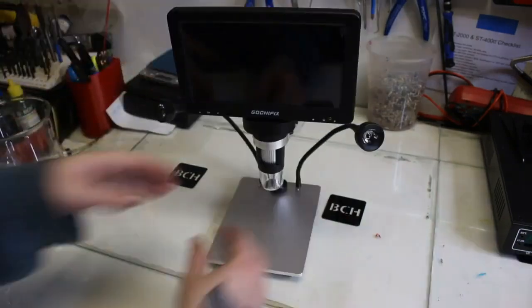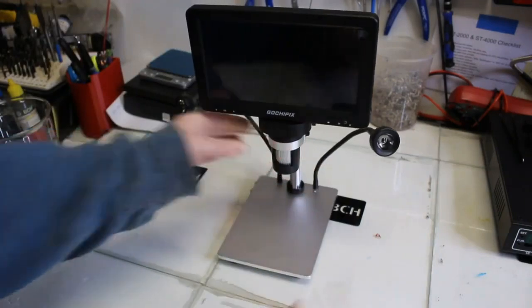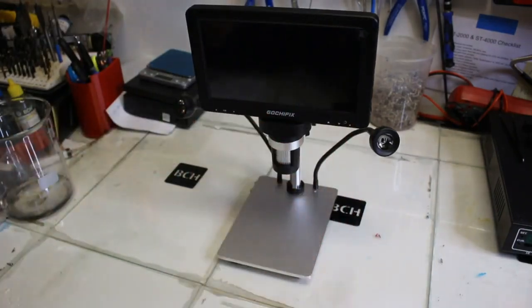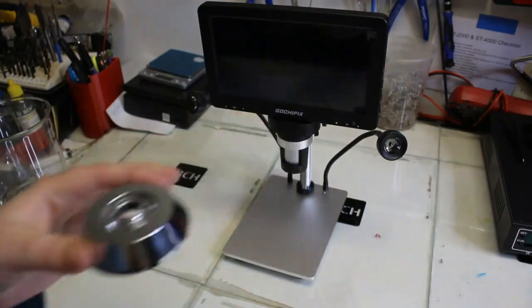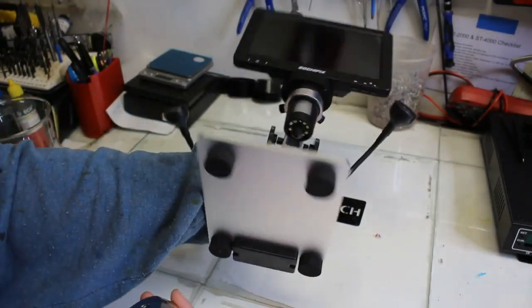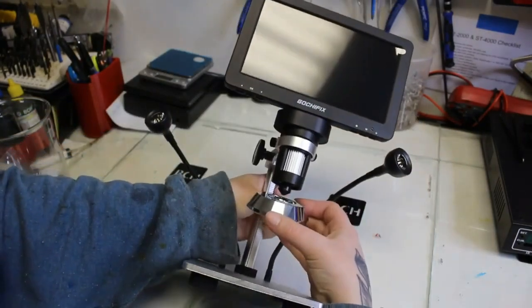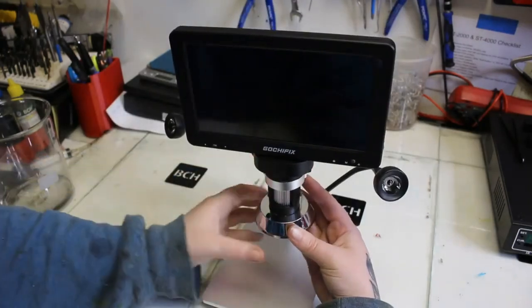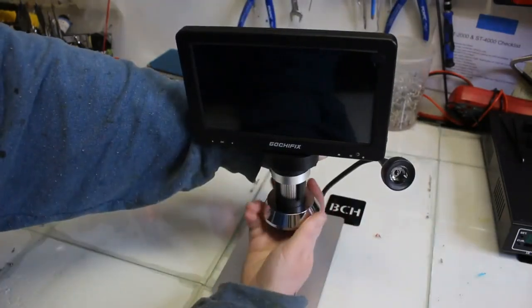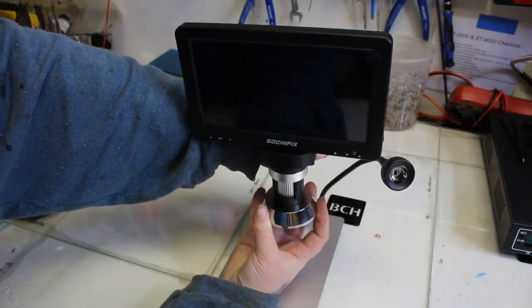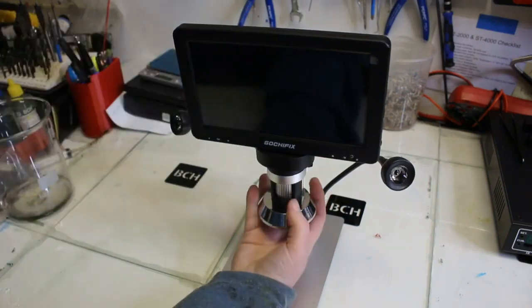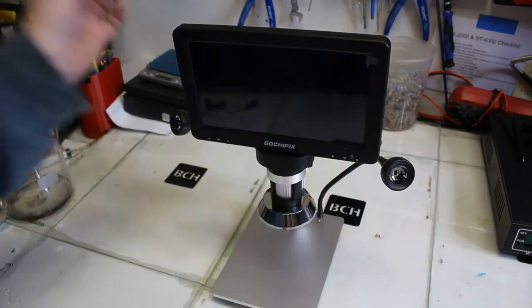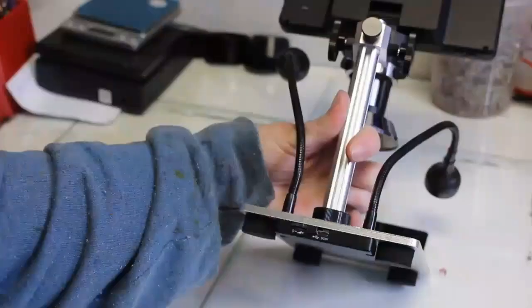Now the next thing I'm going to do is I want to take off my light lens and you can keep that on there if you want to and the way to take it off is you just pull it straight down. There's no screwing lefty loosey righty tighty. Now we're going to have the light shield come on here. You're going to want it to be the lens fanning out and instead of doing righty tighty lefty loosey again this and the instruction says to just twist it back and forth left and right and I felt a little bit of a click and then I just pulled down slightly to see if it stuck on which it did.